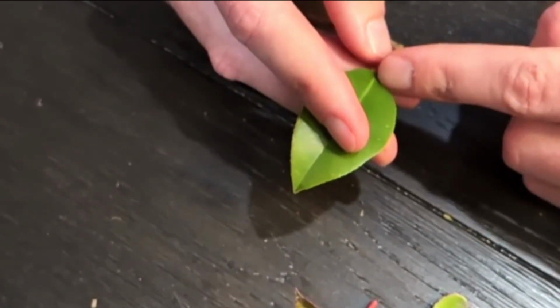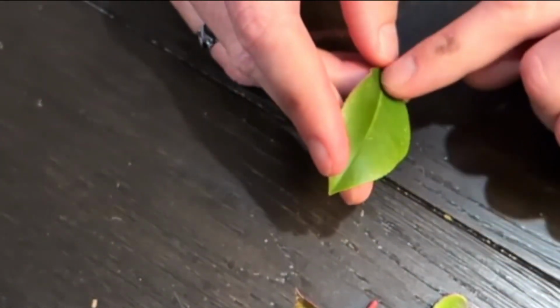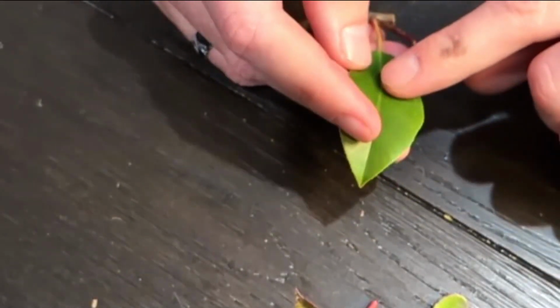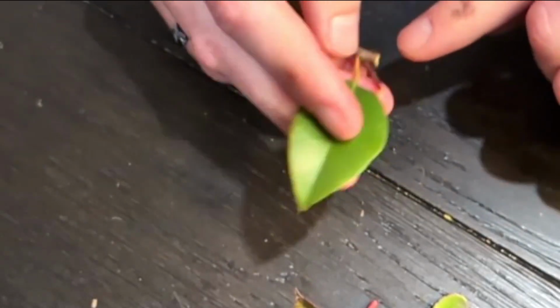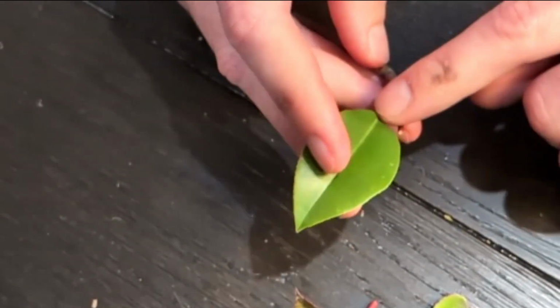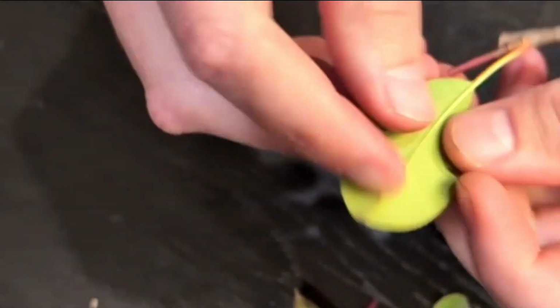back of the leaf. Now, down the middle, depending on which leaf type, we have a midrib, which is basically the largest vein. So that's going to be the one that's taking the vascular tissues from the stem through the petiole, and the main one that carries it throughout the leaf. It'll separate out. You can kind of see them here. Let's see if I can get it to focus. You can see the little sideways veins there, kind of all over. If I flip it over, you might see it better.